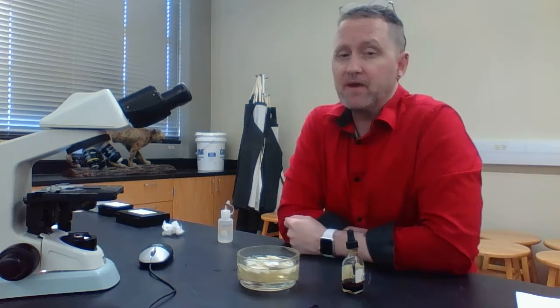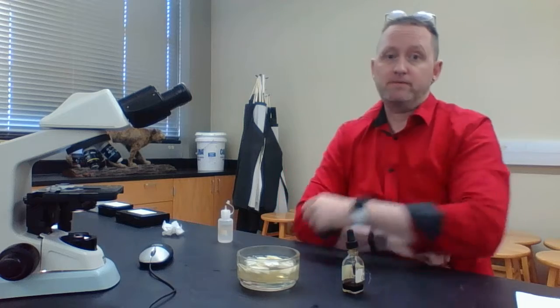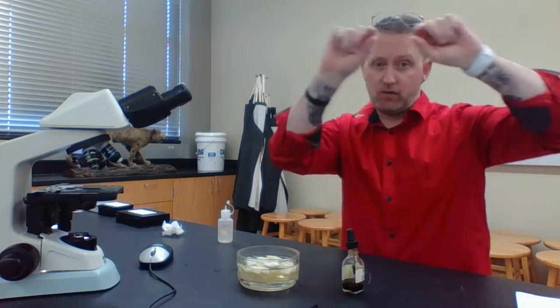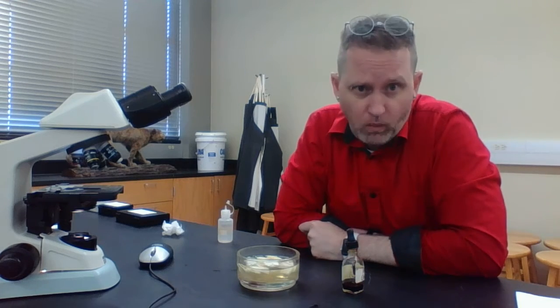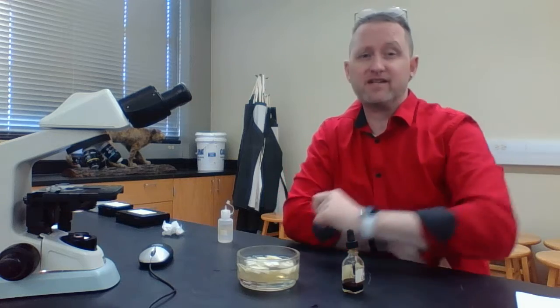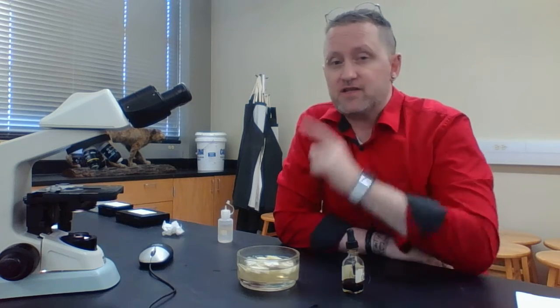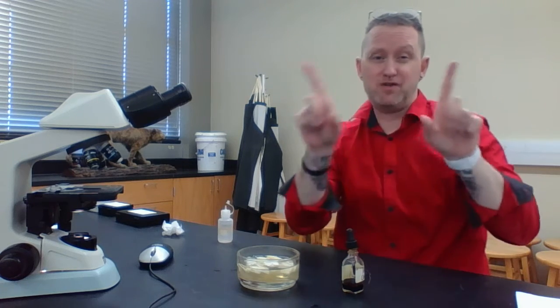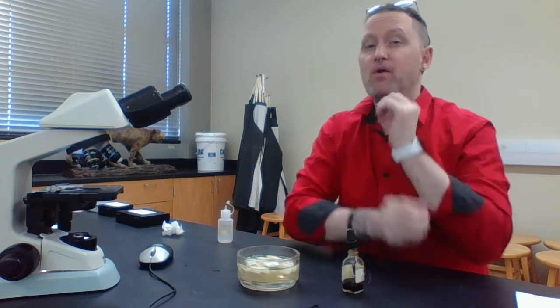But one thing I want to point out, when we talk about resolution, it's when two smaller objects are close together, can we see them as two objects or do we see them as one object? Hopefully you know that each plant cell is surrounded by something referred to as the primary cell wall. You're going to be looking at a couple of plant cells that are all next to each other. When you look at this, you only see one plant cell wall, which basically means that the primary cell wall of plant cells is less than 0.2 microns. So instead of seeing two plant cell walls, you only see one.